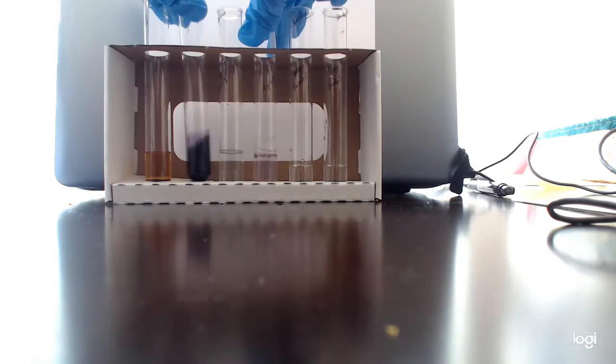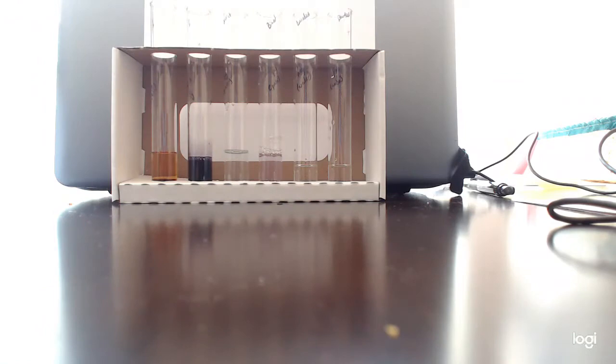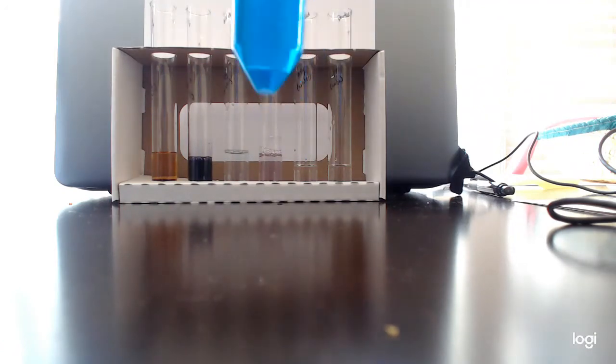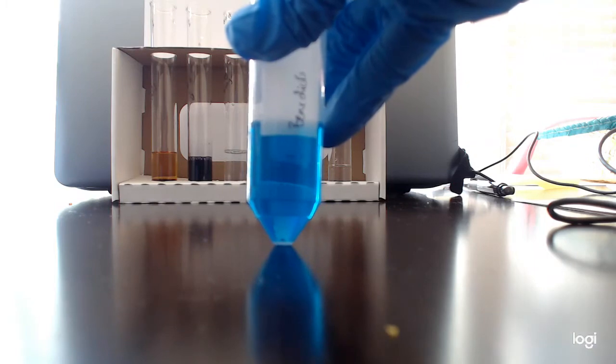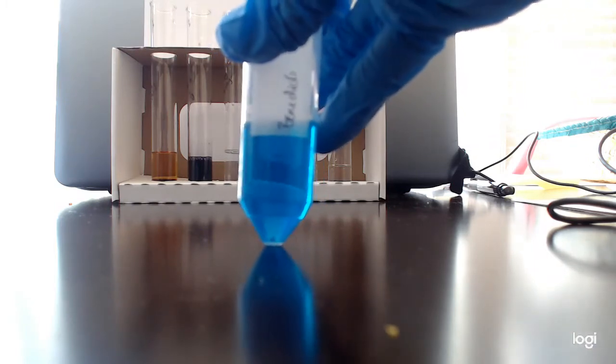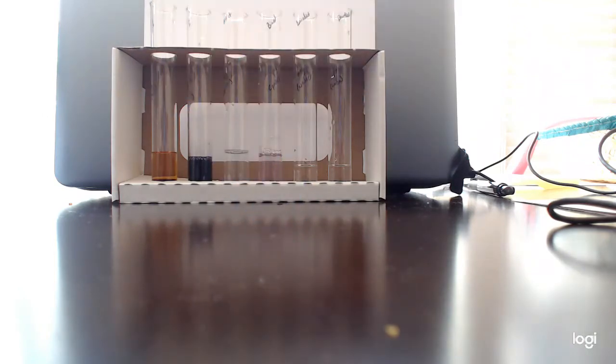Okay? That brings us to our final set of controls for today. That's going to be the sugar test, or the Benedict test. That's going to be using the Benedict solution, which you can see instead of being light blue, it's kind of this electric cobalt blue that's really bright, maybe even teal. And again, with this, we're going to add about 5-10 drops of this Benedict test solution into our tubes. So you guys can count with me, and you guys will probably do a better job counting than me.